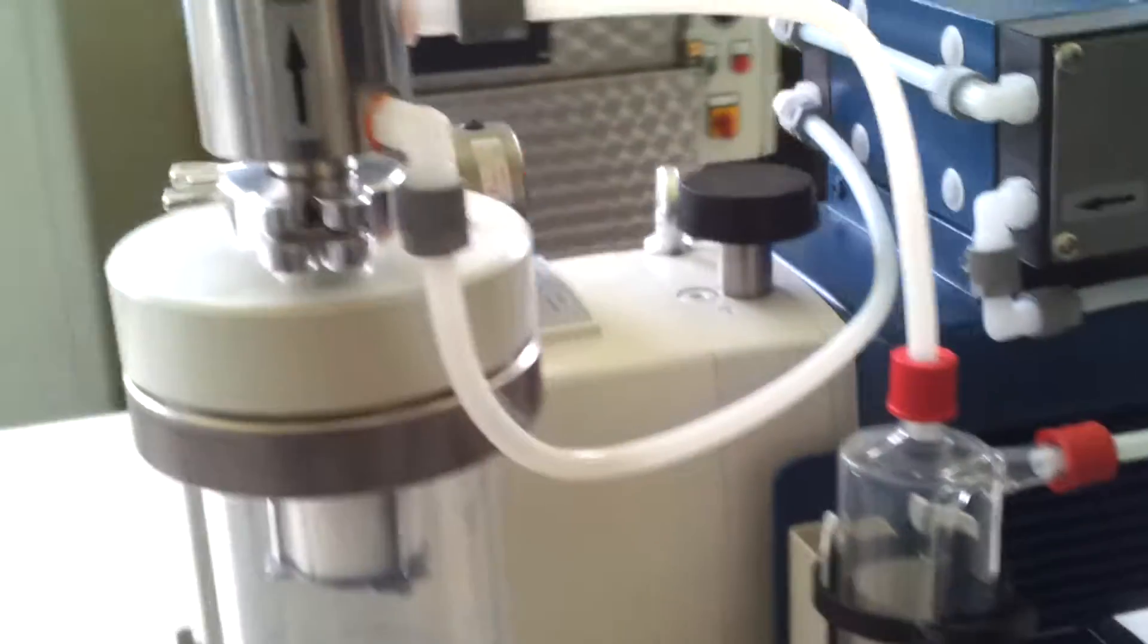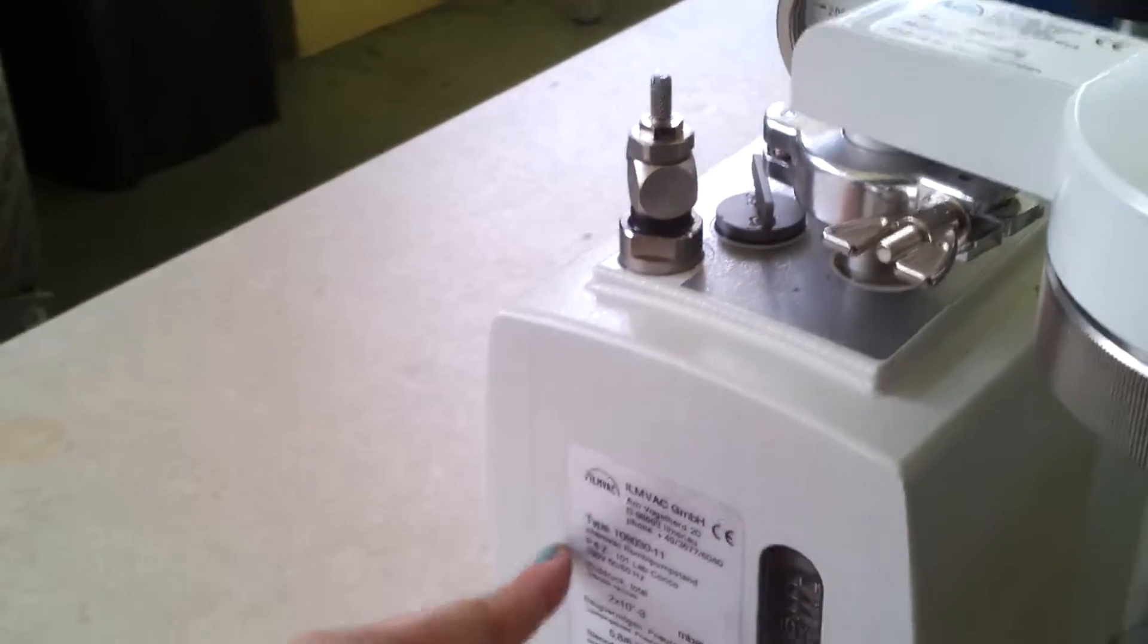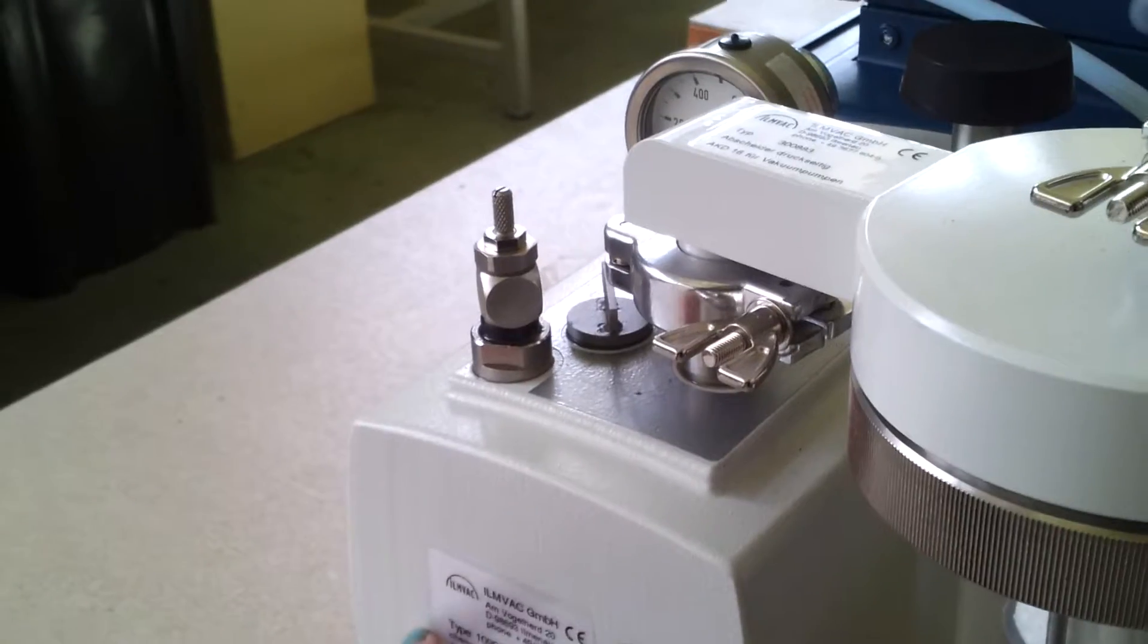What we see here is the rotary vane pump connected to a diaphragm pump. This plug goes all the way inside to the oil with a little bubble, and it's foaming.